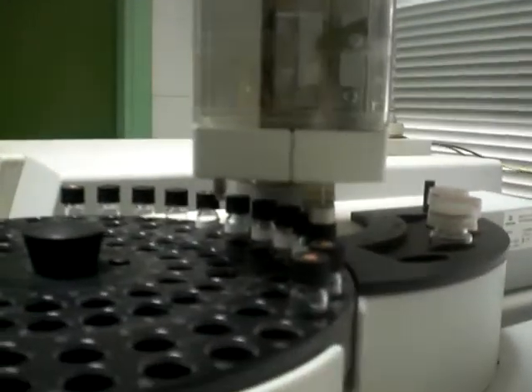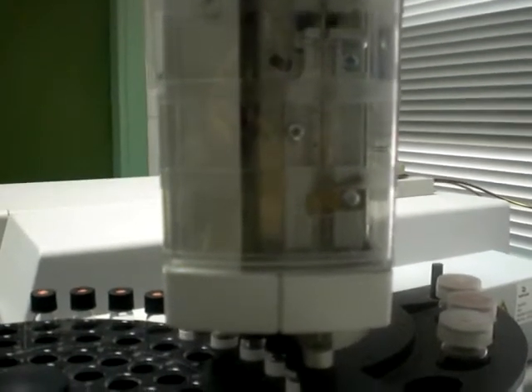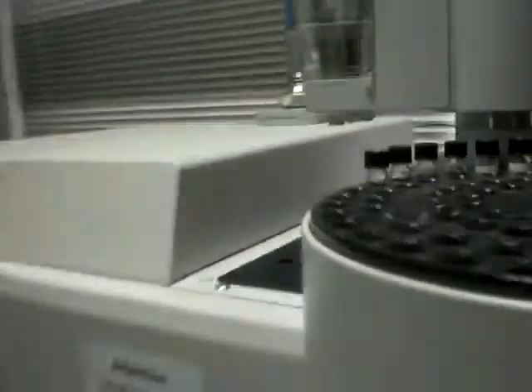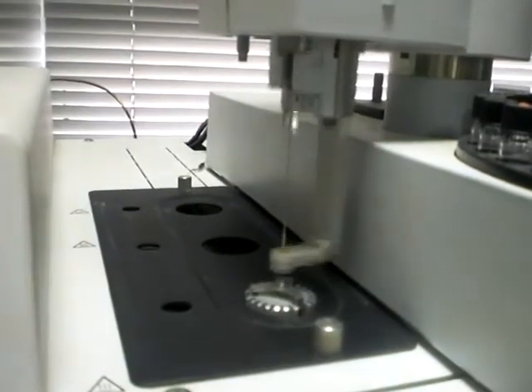See now, see the needle. This is the syringe. It takes a certain volume from our sample, many times, to remove any possibility of air bubbles in the last sample. Now the sample will be loaded into the injector.